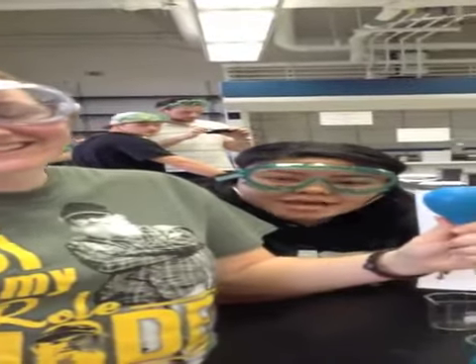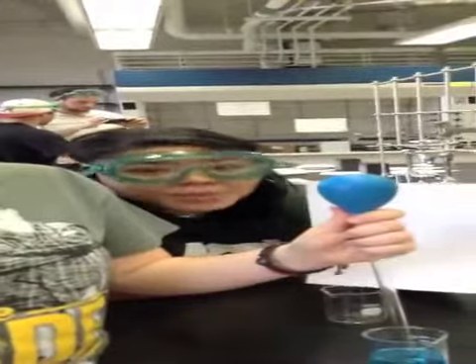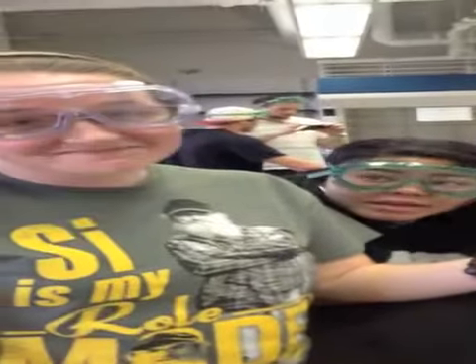So Casey's having a hard time figuring out what she wants to say. So I'm going to help her with her lines. Casey, come on honey. Alright, so the first thing you're going to do is you're going to say that it's already been primed. It's already been primed. Alright, now suck the water up.